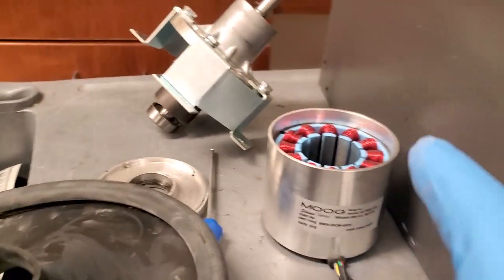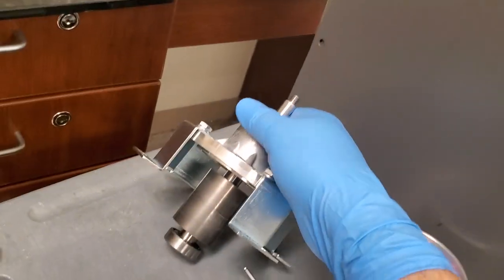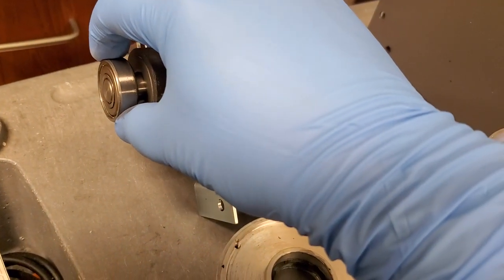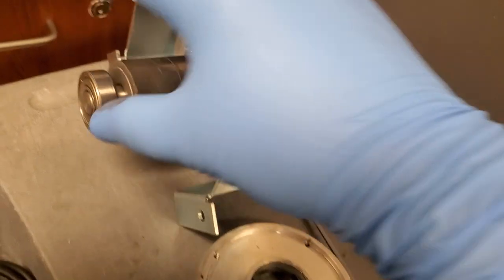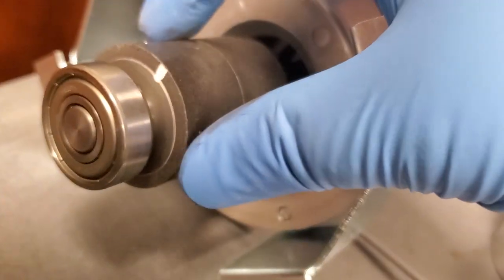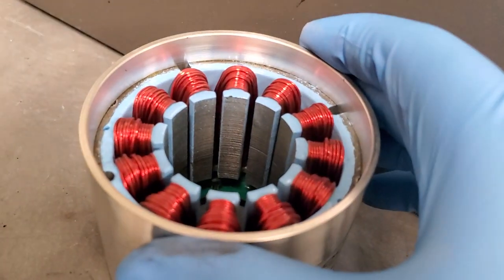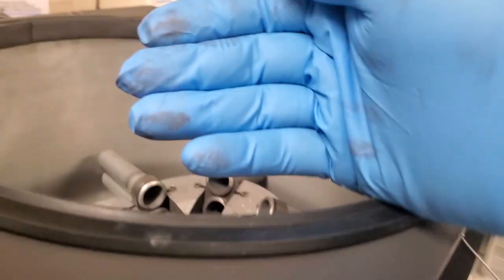So what happens is, over the course of time, especially if the rotor is out of balance and they don't detect it, what will happen is your bearings... I don't know if you can see that, but it is wobbling. And when it wobbles, you have right here your permanent magnet for the motor, and your magnet will start to wear on your stator. It will rub, it'll etch, and it creates this really fine dust, and it gets all over everything.